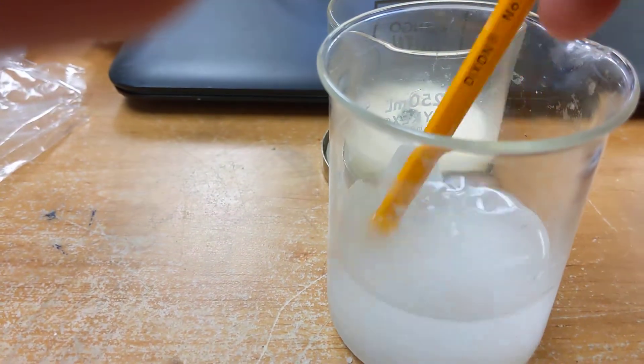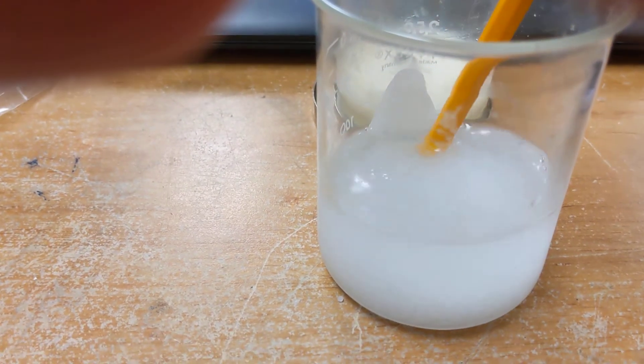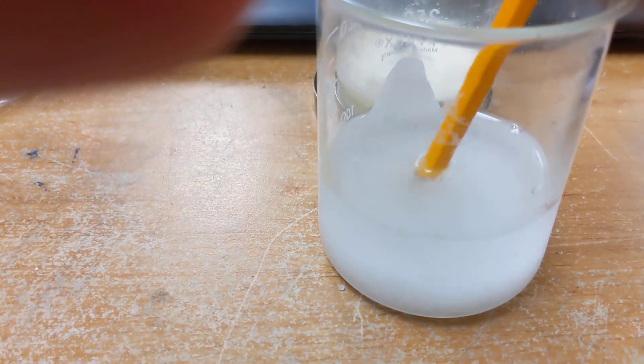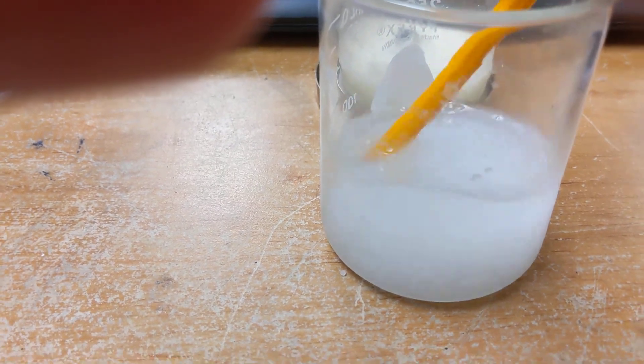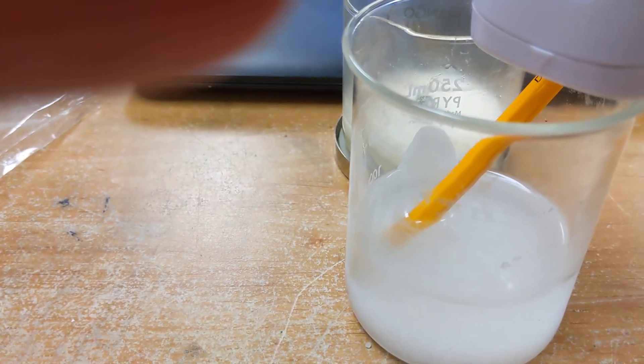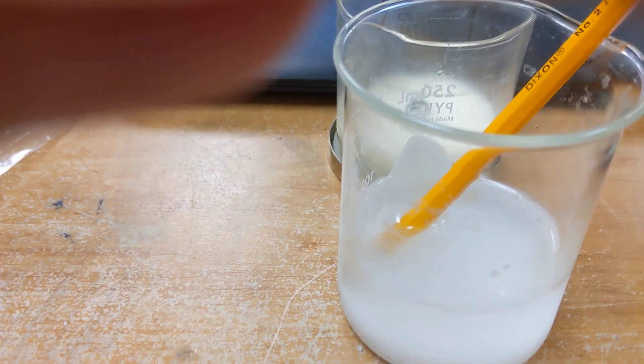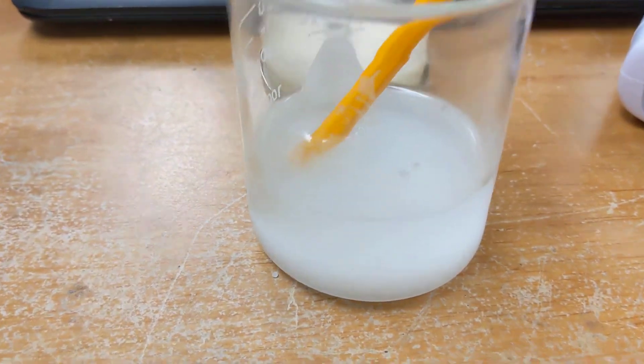The beaker is what I'm stirring it in. If you notice, there's not very much solid left at the bottom now because it is being converted into liquids and gases. It's still cold. The temperature has bottomed out at about 42 degrees.